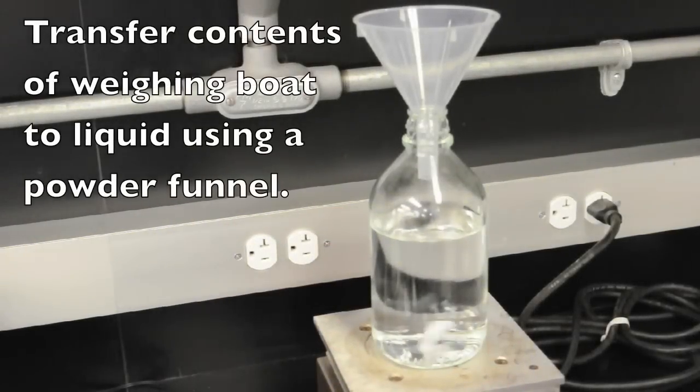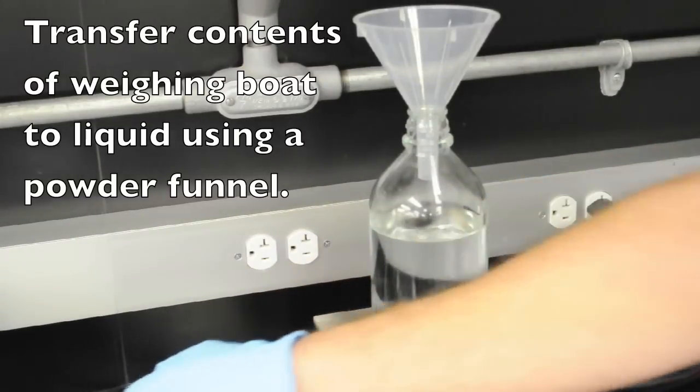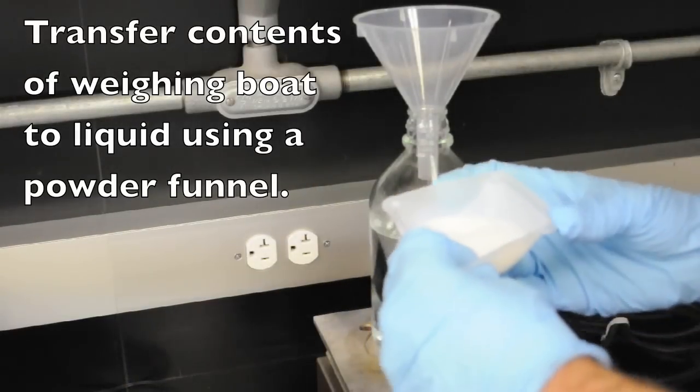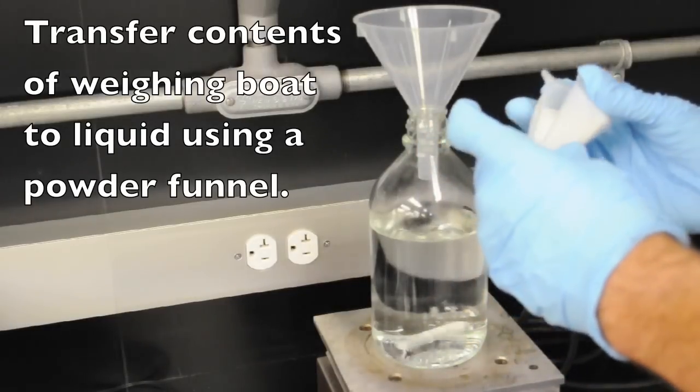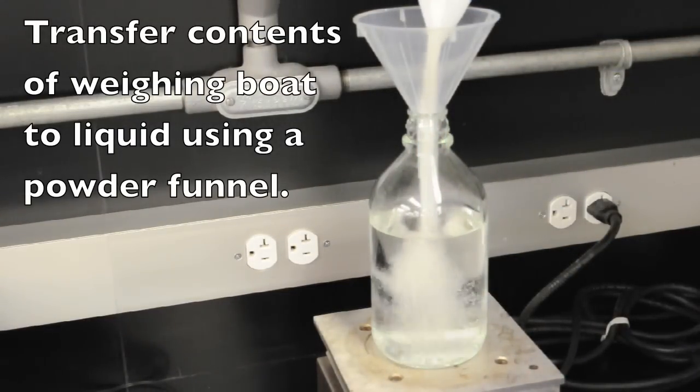We fold the weigh boat in half. We never reuse these. They're disposable. And add the contents then through the powder funnel. We're going to shake off any excess. Discard the weigh boat in the biohazard trash.